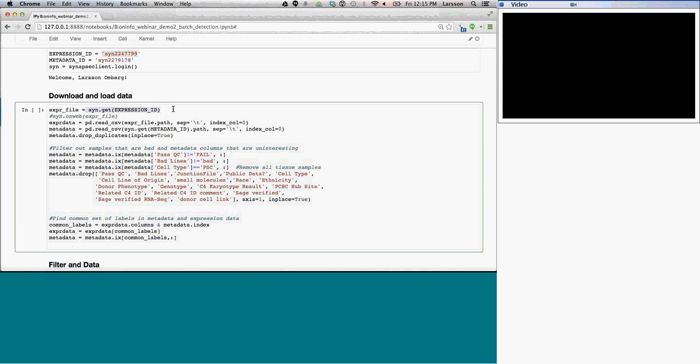What this does is it downloads it for me, and then the next step is reading it into memory, and I'm using a pandas data frame for this, which is similar to an R data frame. And then I am also fetching the metadata and reading that in as well. It turns out the metadata has some rows that are duplicated, so I get rid of those. And then I filter out those that fail QC, and this could be QC that has been determined prior based on the alignment, so these are cell lines that have been considered to be bad.